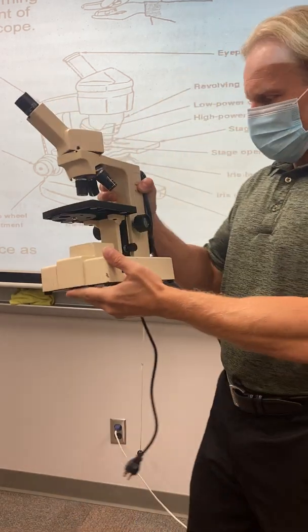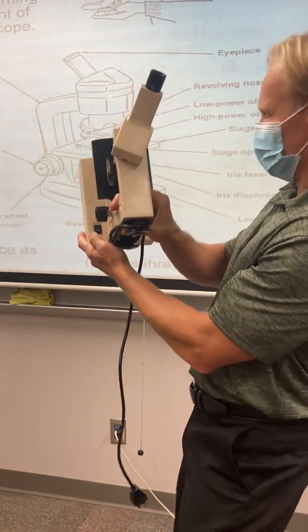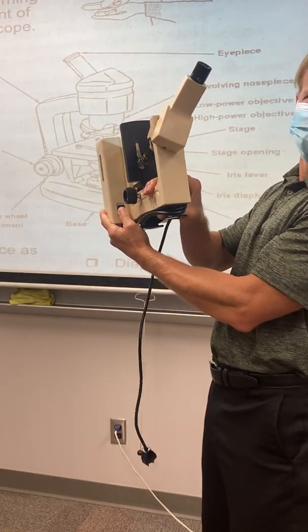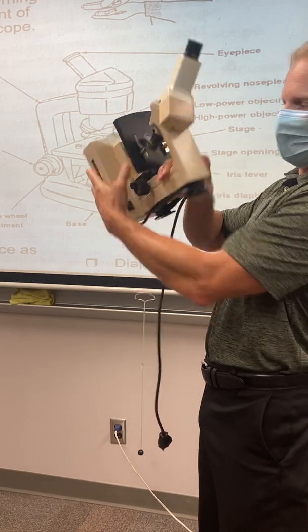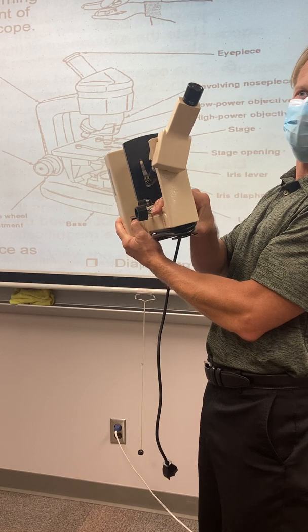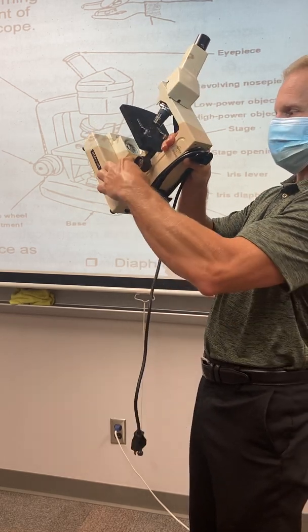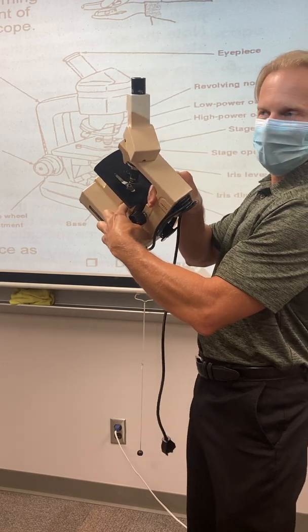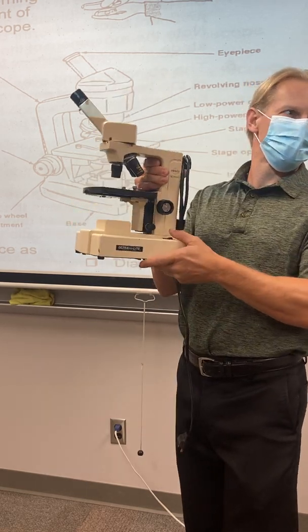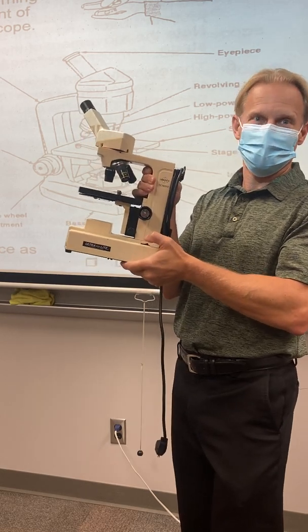Now, some other parts of the microscope. A very important part is the button down here that turns the light on. There's a lamp down below, and this button right here will turn that on and off. It's not in the same spot on all the microscopes. All of our scopes are not the same. On some of them it's going to be tucked in behind here. Some it might be up in here. It's in different locations depending on which microscope you have, and that's totally fine. You just have to figure out where it's at.